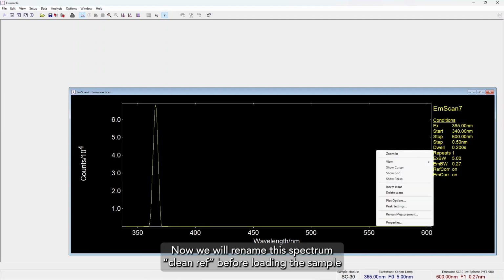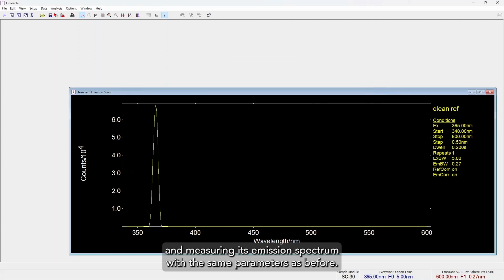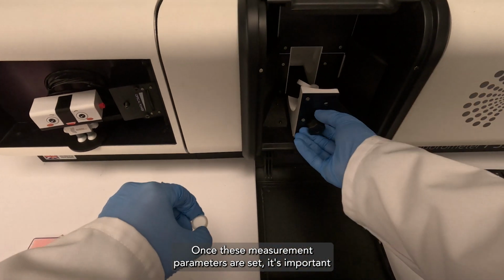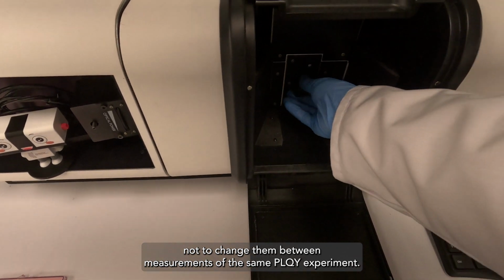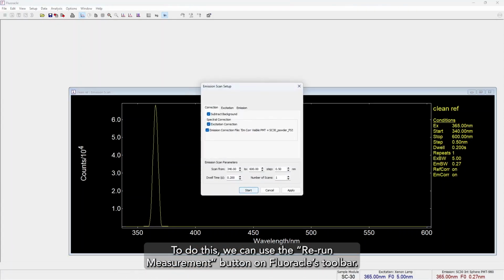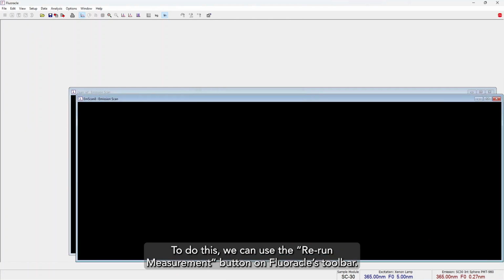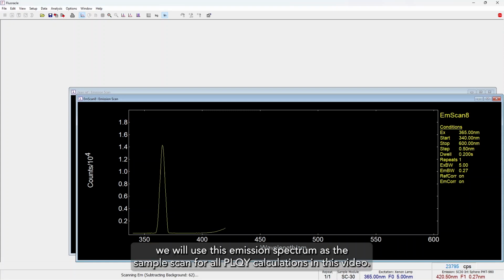Now we will rename this spectrum clean ref, before loading the sample and measuring its emission spectrum with the same parameters as before. Once these measurement parameters are set, it's important not to change them between measurements of the same PLQY experiment. To do this, we can use the Rerun Measurement button on Fluoracle's toolbar. To test the effect of cleaning reference plugs, we will use this emission spectrum as the sample scan for all PLQY calculations in this video.